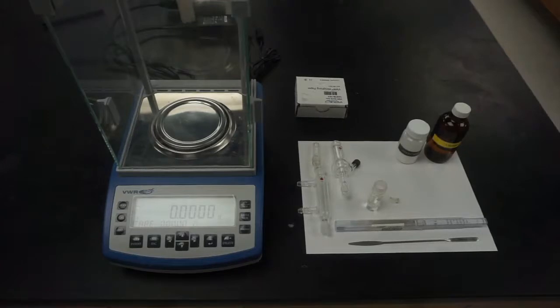Hello, everyone. Today's experiment is synthesis of N-butyl bromide.